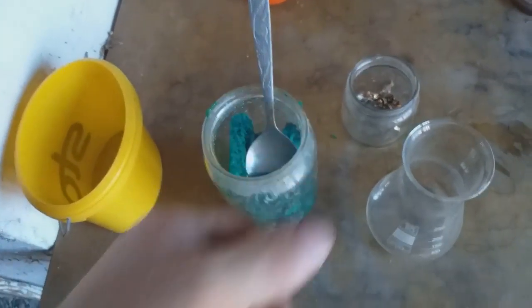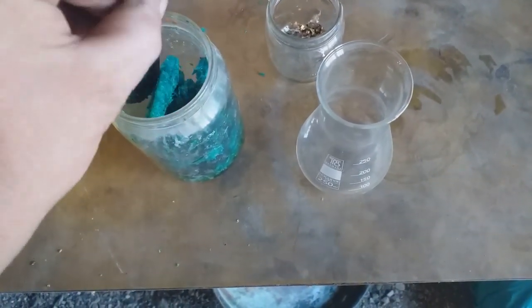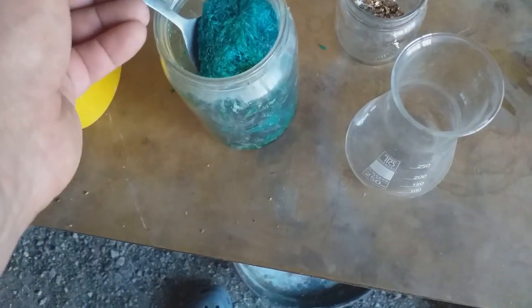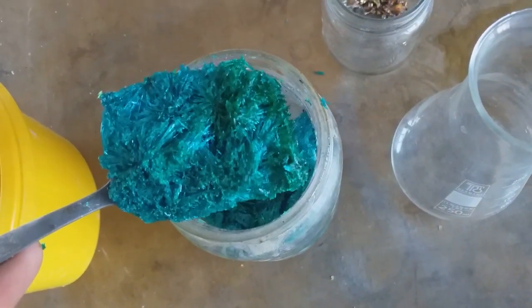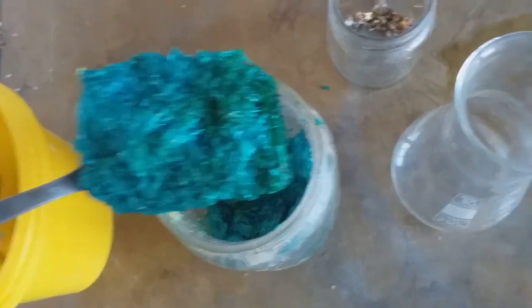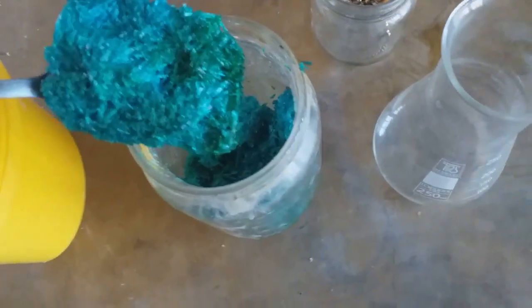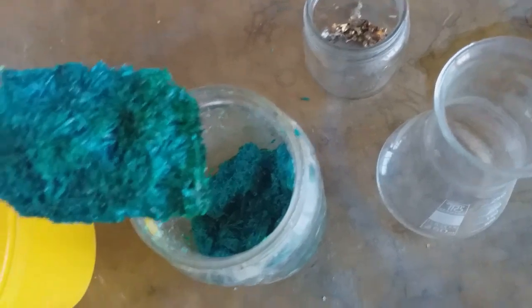Hey guys, what's up? Today we have a little short video about this stuff. This is a copper chloride crystal I accidentally produced about two years ago, and from then I keep them in a jar. You will see later what I use that stuff for — I start that crystallization from copper waste solution.